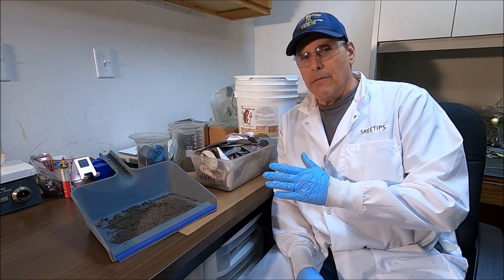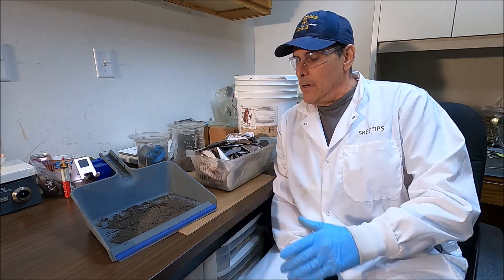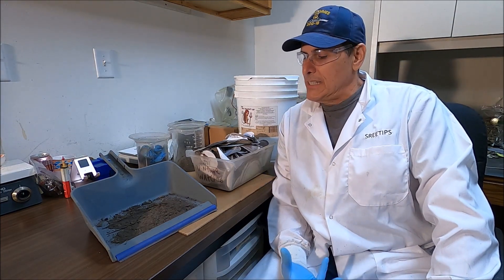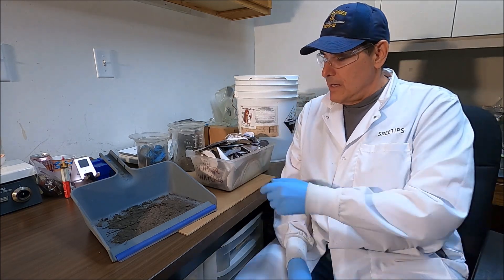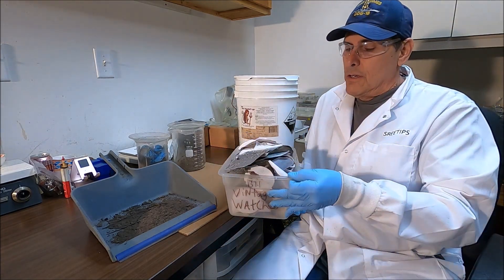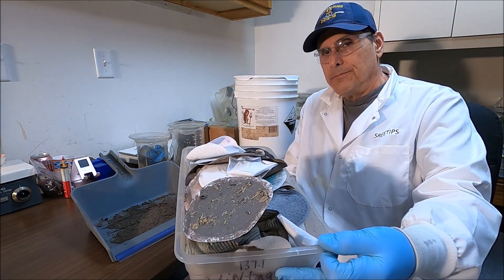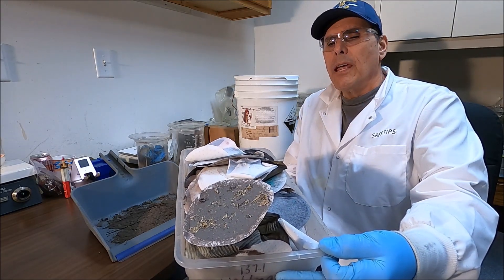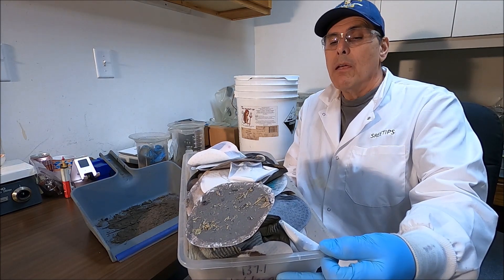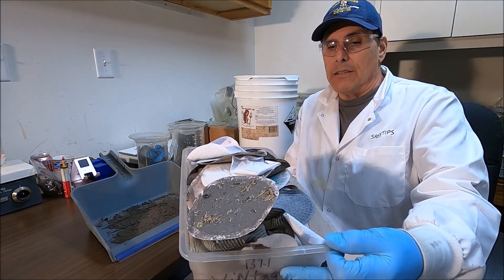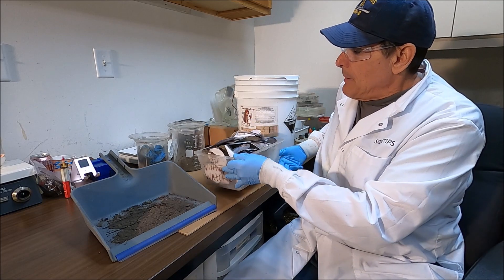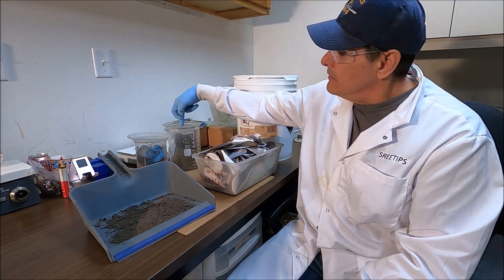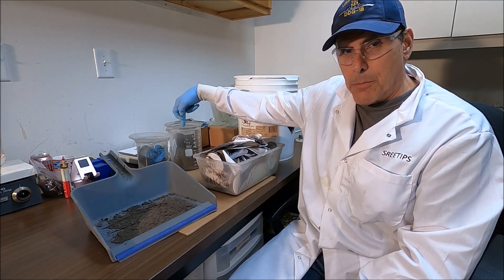Today what I have is an assortment of filters and other waste material that I'm going to try to process for us today. It's mostly filters. This is a filter bin that I save all my filters from my gold refining operations and my silver refining when I dissolve the silver and filter out the solids. I keep the filters. Back here I've got a jar of material that I've already incinerated and it's been sitting here waiting for me to process.